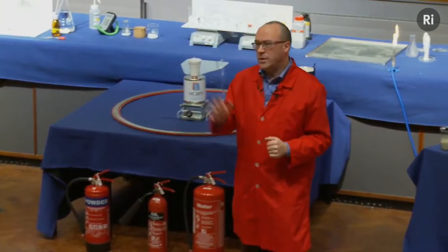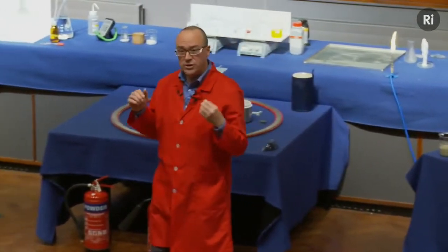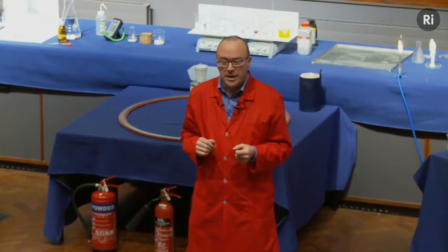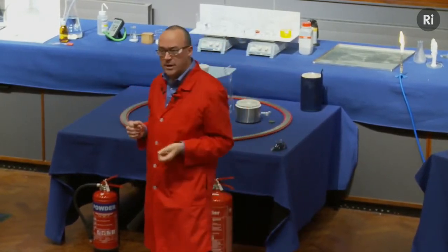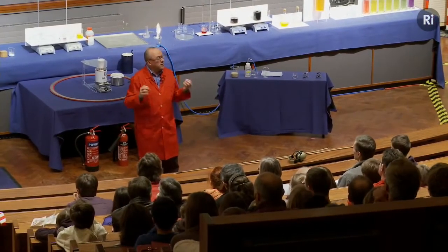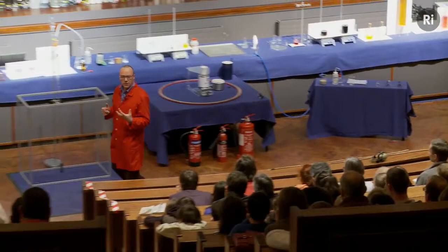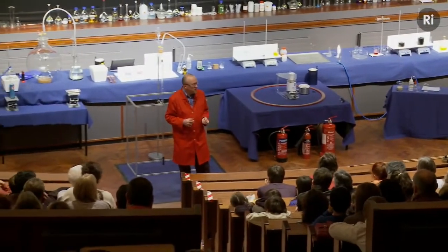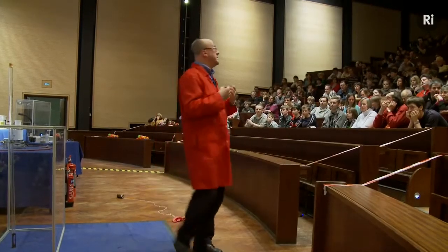Okay, so we'll keep that thought in mind, and we'll look at some other examples of chemical reactions that give out energy. Now, we've seen energy being given out in the form of a bang. We saw a little bit of light being given off there in the form of that flame. I now want to show you a reaction that gives off a great deal of light. And it's the reaction of a rather special element. It's called phosphorus. And the word phosphorus comes from the Greek. It means the giver or the bearer of light. So this is a reaction that will give out a great deal of light.